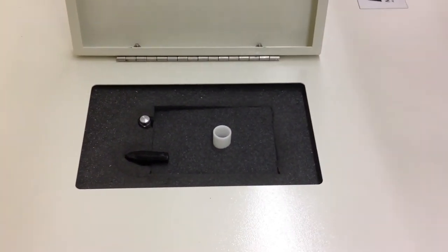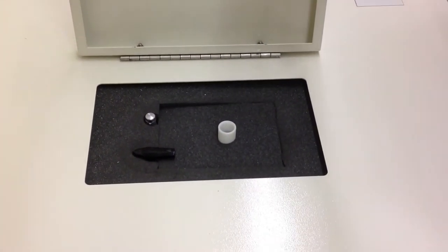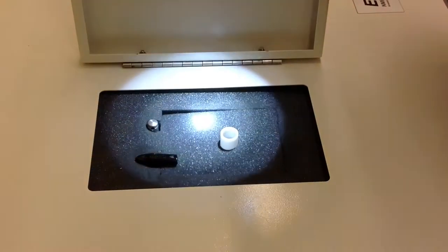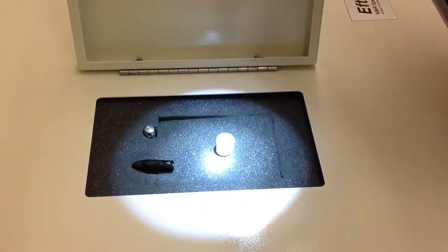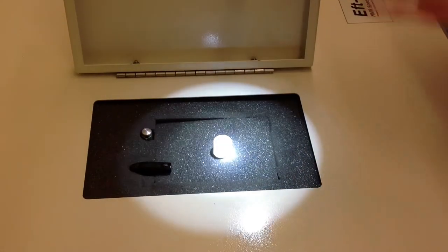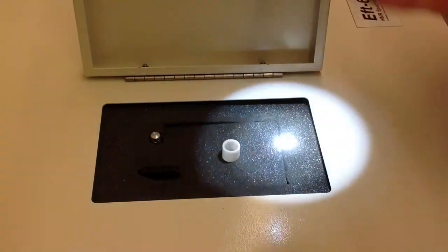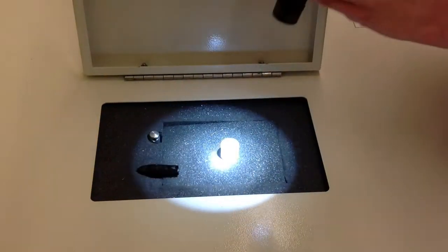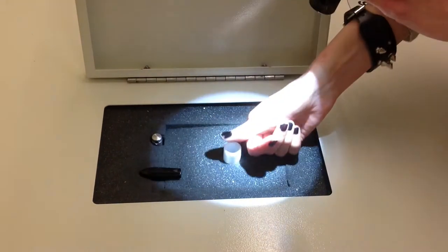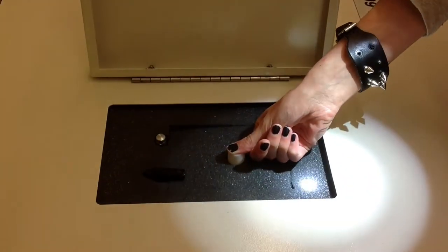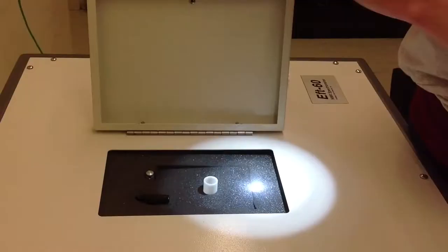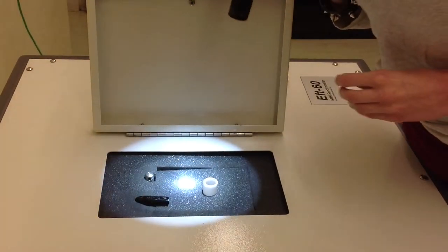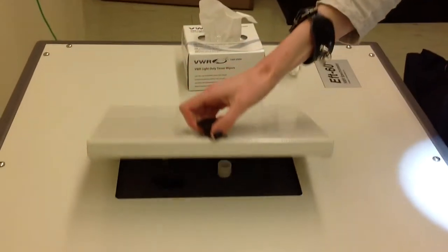Now you have to check with a flashlight to see if it's spinning. The best way to tell is if you can see a black dot, that means it's not spinning. But if you don't see one, it's spinning and right now it's definitely not spinning. I place my thumb over and then I check again. Now I have it spinning. Now you close the compartment door.